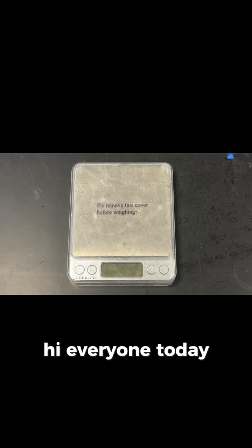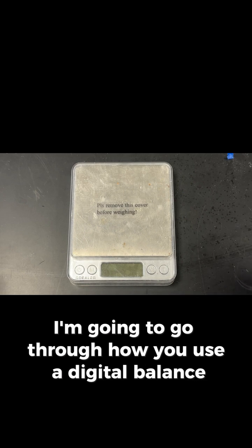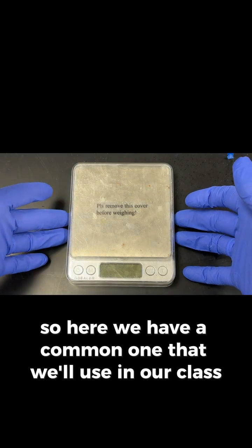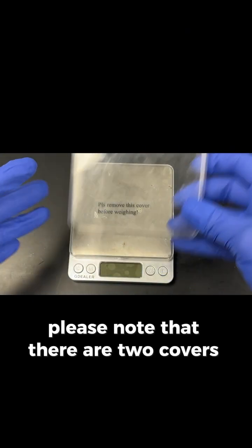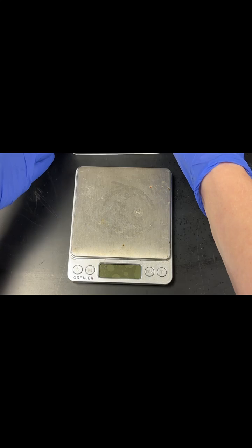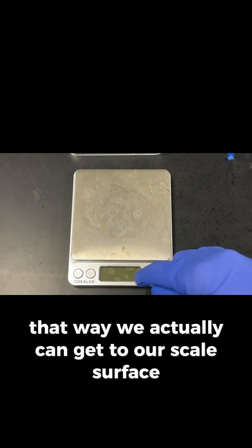Hi everyone. Today I'm going to go through how you use a digital balance in the chemistry classroom. So here we have a common one that we'll use in our class. Please note that there are two covers on many of these, and so we need to make sure we remove both of them. That way we actually can get to our scale surface.